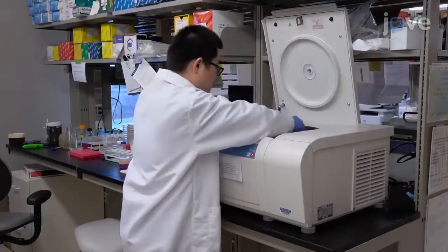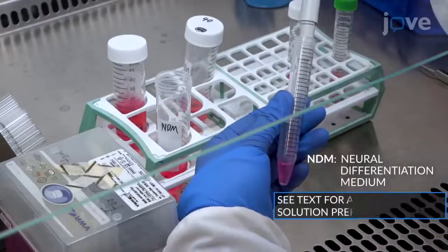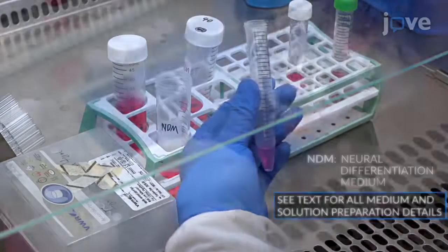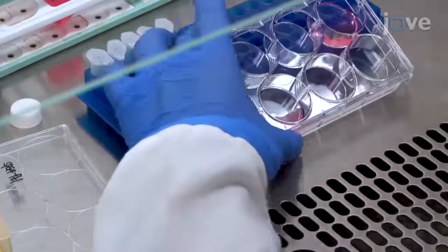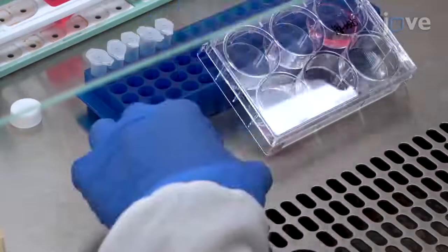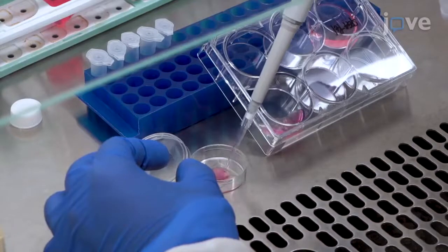At the end of the incubation, collect the cell clusters by centrifugation and resuspend the pellet in one milliliter of NDM. Plate about five clusters of cells in 100 microliters of medium per polyornithine and basement membrane matrix-coated 35 mm glass bottom dishes.